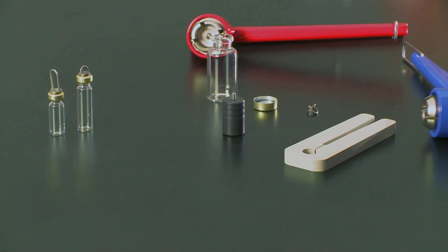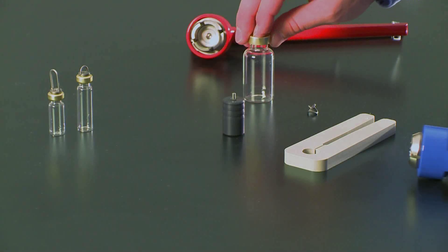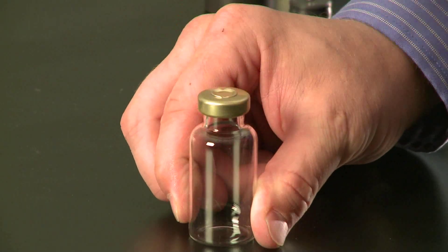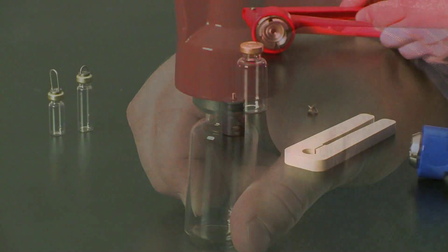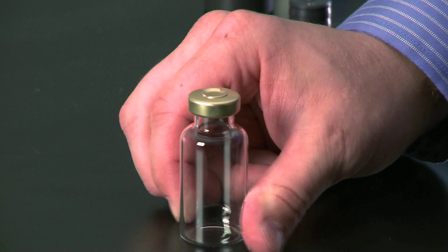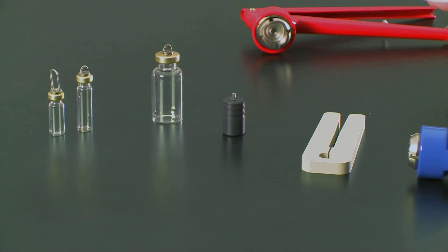The process is a little different for the 20 milliliter ampule. We have a different, larger crimper. You would prepare and weigh your sample into the ampule and crimp until you stop. We have a centering tool, but it's not necessary since the diameter of the cap is smaller than the actual ampule. So find near center, pierce a hole with the lifting eyelet, place it in, clean off the fingerprints, and now all three ampules are ready to go.